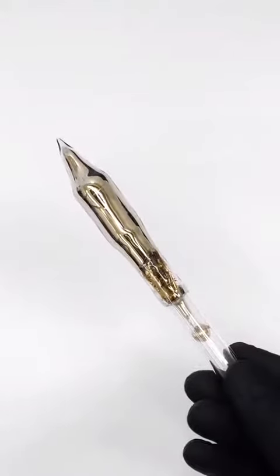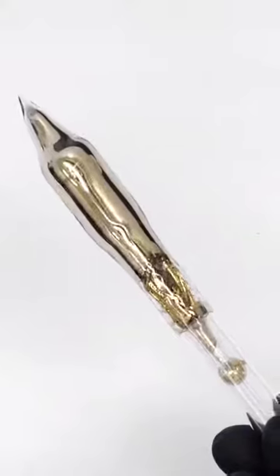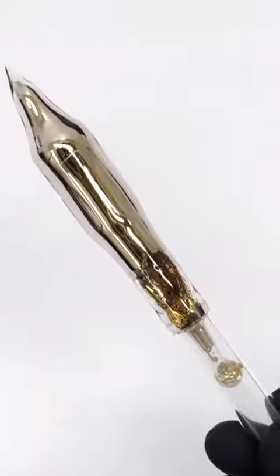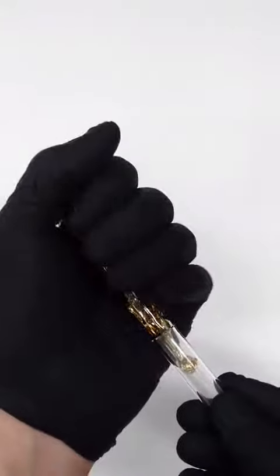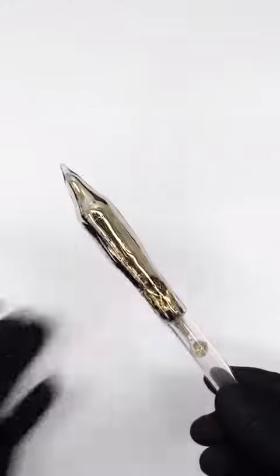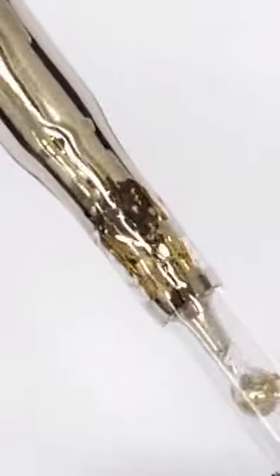This is very similar to potassium or sodium, but it's even more reactive. It's kept in this glass ampoule to protect it from air, and having it break open could be really dangerous. What's interesting though is what happens if I hold it for about 20 seconds — just the heat from my hand was enough to melt it, and I now have some slightly golden, liquid metal.